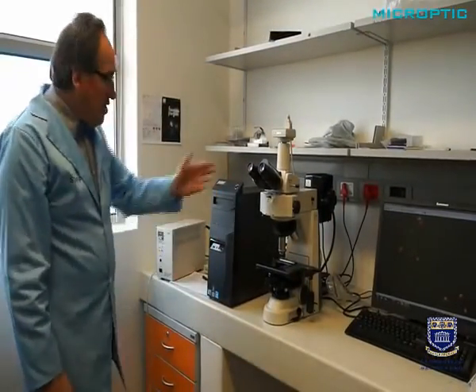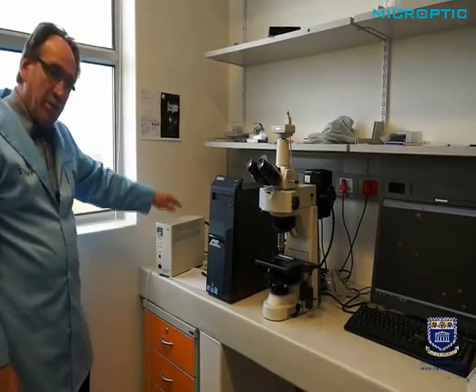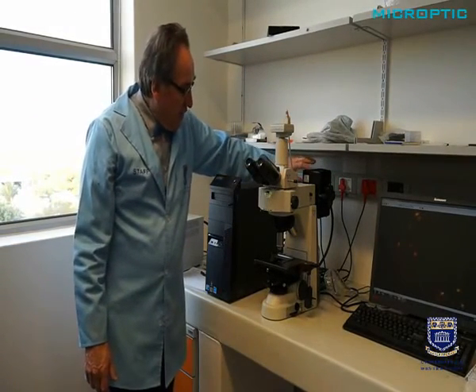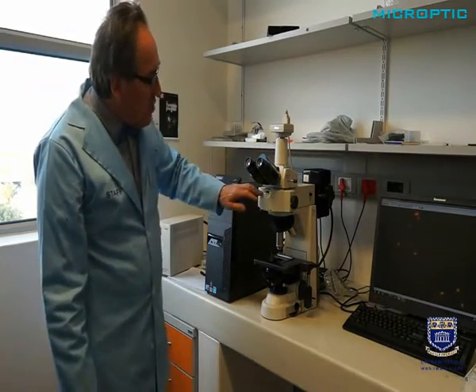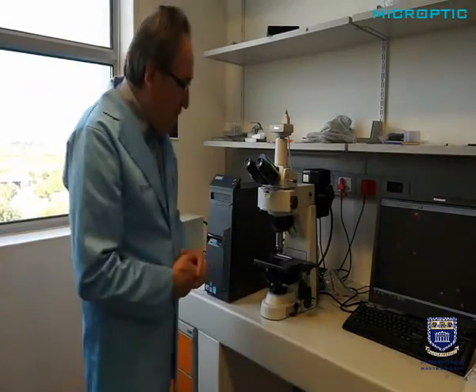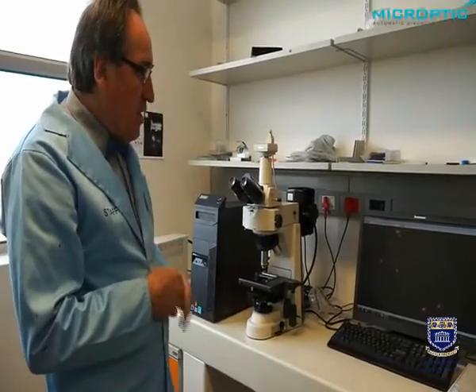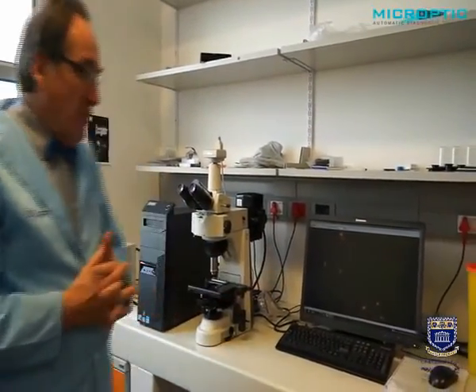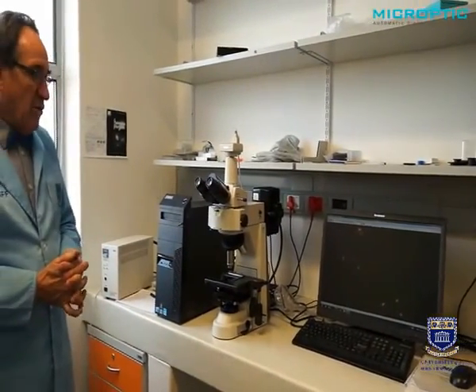And in this instance we have of course a super high pressure mercury lamp with which we drive the lamp which sits in this housing, and here we can select of course our filters, the different kind of filters required, and it must be done in absolute darkness of course, and that is a typical fluorescent image that you see on the screen. And so this is the basic setup again for fluorescence microscopy.